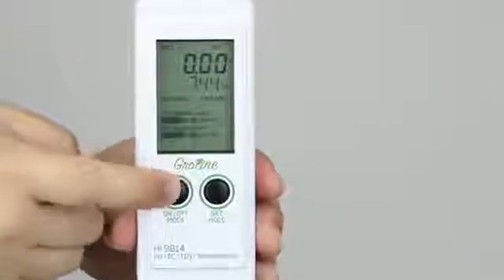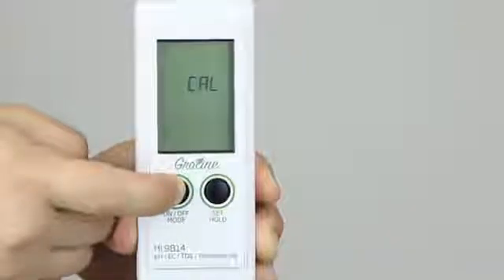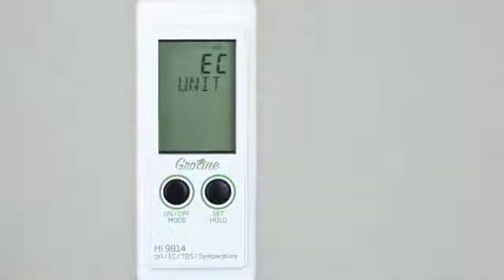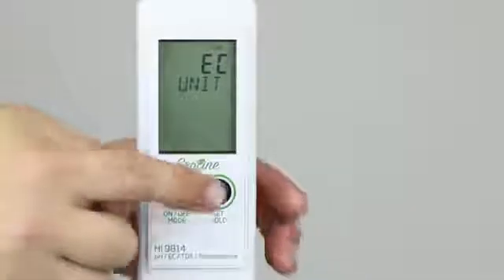Modify the current setting by pressing and holding the mode button for six seconds. Off and Cal messages will be displayed before entering setup mode. Currently, the meter is set to display concentration as EC. To select TDS in parts per million, press the set button.